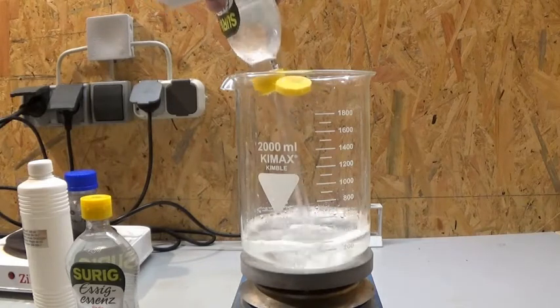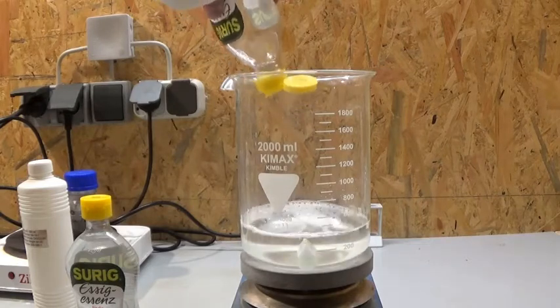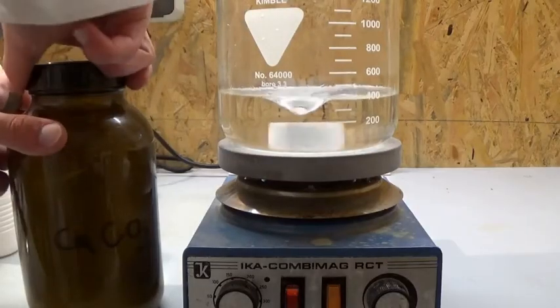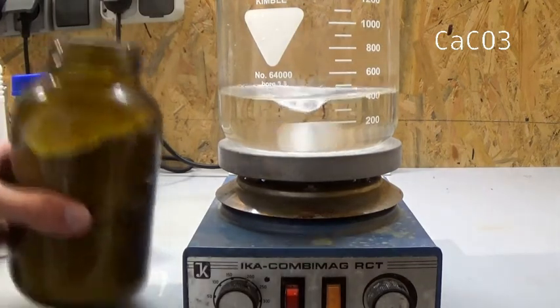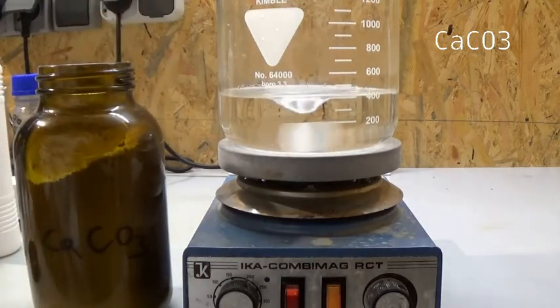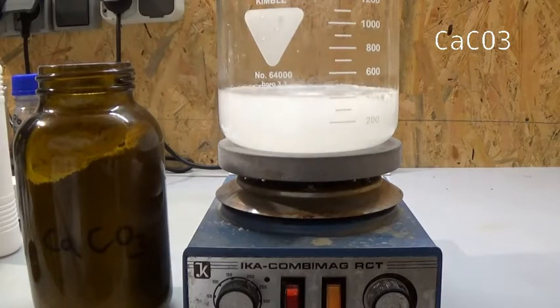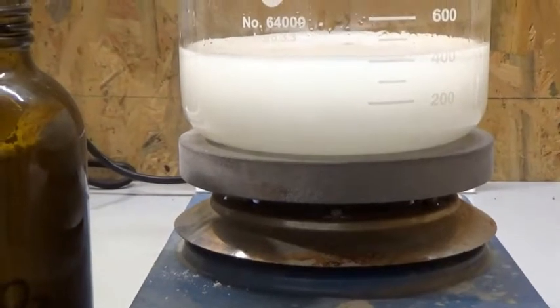My goal for this video is calcium acetate, so I need to neutralize the acetic acid with a basic calcium compound. I am using calcium carbonate because it is cheap and easy to get for everyone. While adding the calcium carbonate I am going slowly to prevent over-foaming, which can occur due to the high amount of carbon dioxide produced in this reaction. The acetic acid is reacting with the basic calcium carbonate and forming calcium acetate and carbon dioxide.